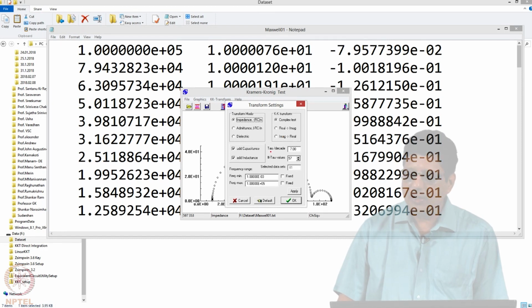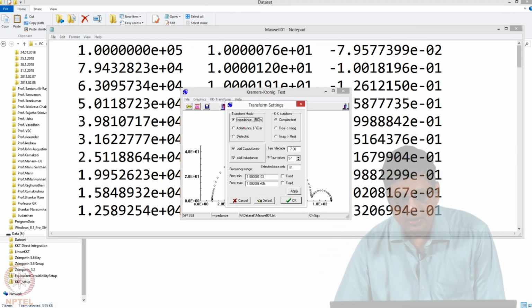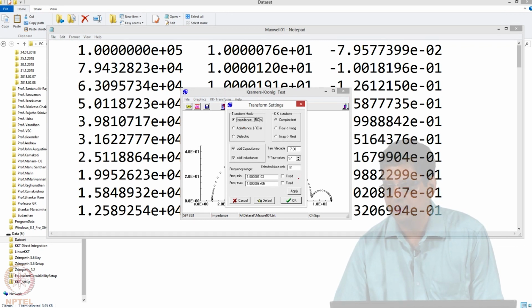The tau value is time constant per decade, default value is 7. You can leave it as it is. This you do not need to touch. It will look at the data and calculate this. You do not usually need to touch this. If you want to change something, it is probably this tau value per decade you can increase or decrease, and try and see what the results are. You will have to use the admittance mode when your data is on the other side, okay.